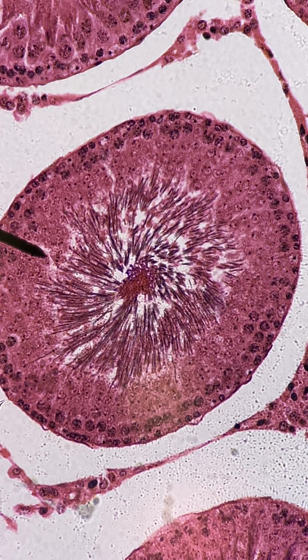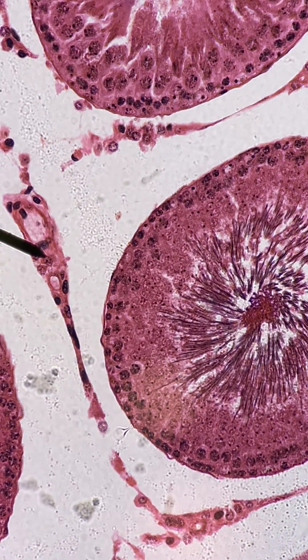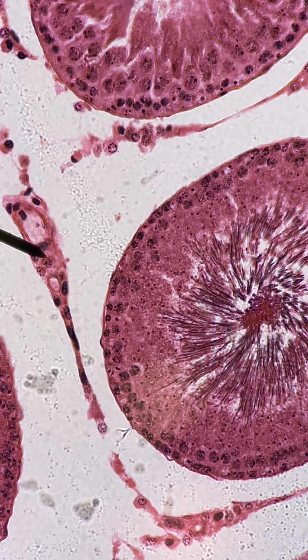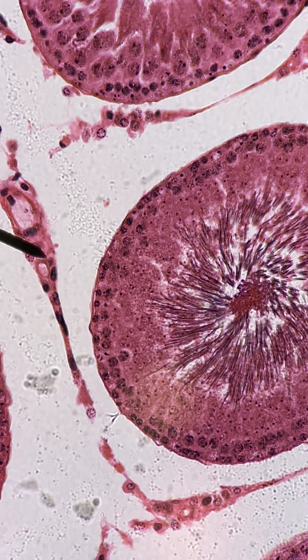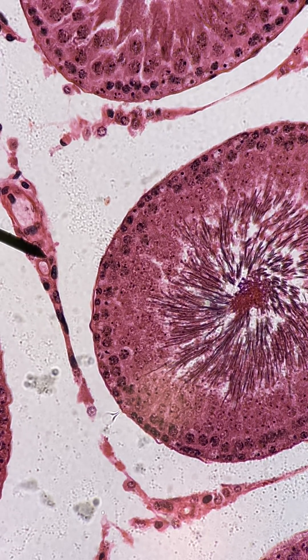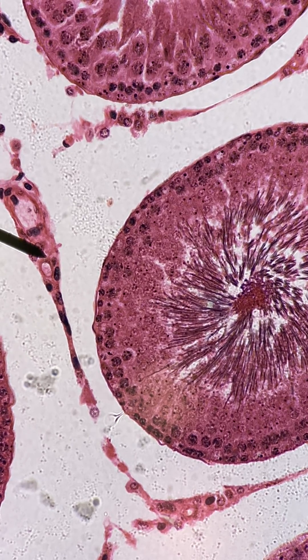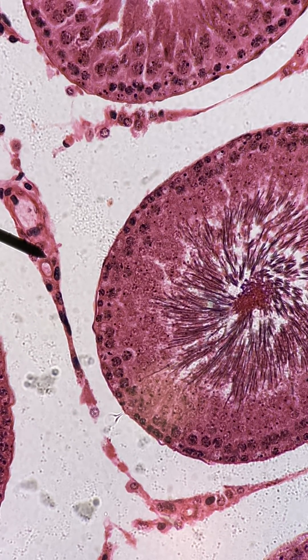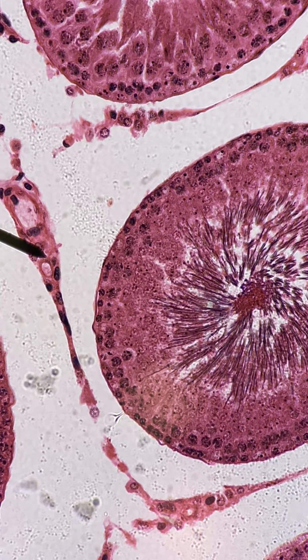Look at these cells that are located in between the seminiferous tubules — the pointer's on them now. These cells are called interstitial cells, or Leydig cells. Let's just go with interstitial because they're in between the seminiferous tubules. These cells produce testosterone, so these are going to be the cells in your testes that are responsible for producing testosterone.